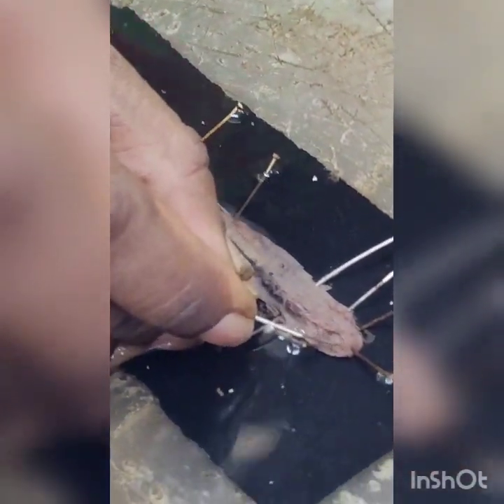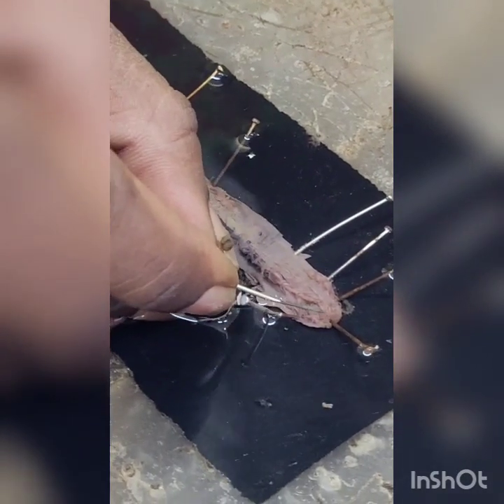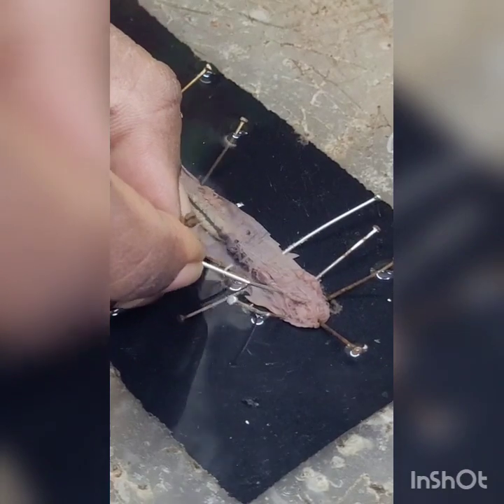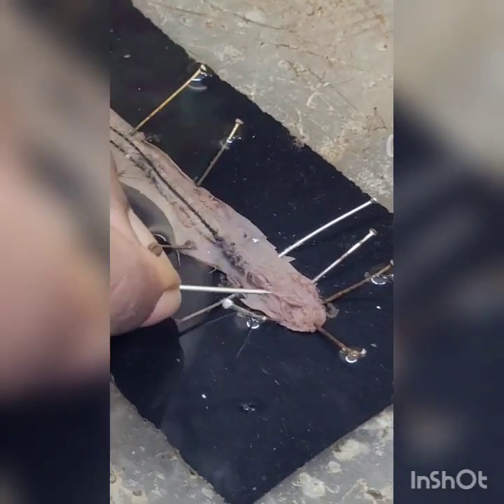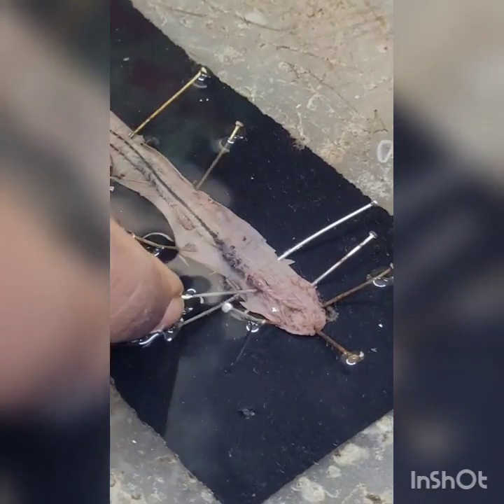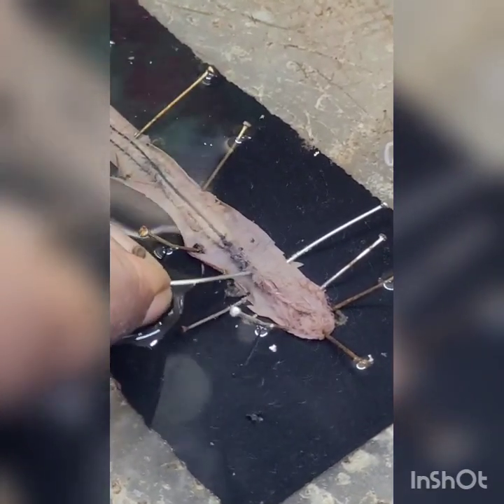You can see the first segment where the mouth opens, then the buccal cavity up to the 4th segment. The 5th to 7th segments form the esophagus. The 8th segment, which I am holding here, is the gizzard. The 9th to 14th segments form the stomach.